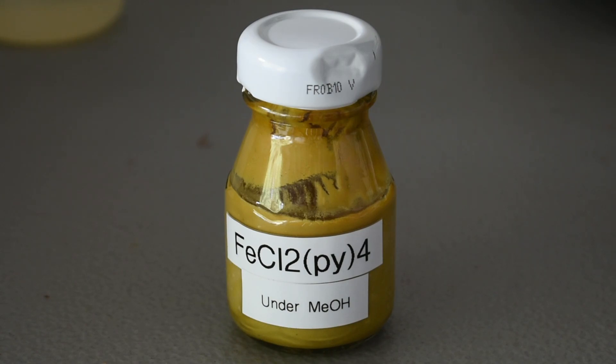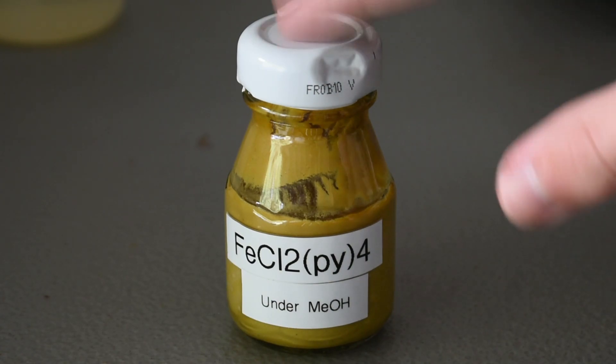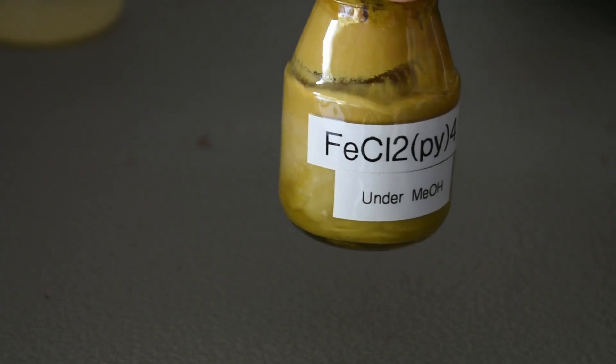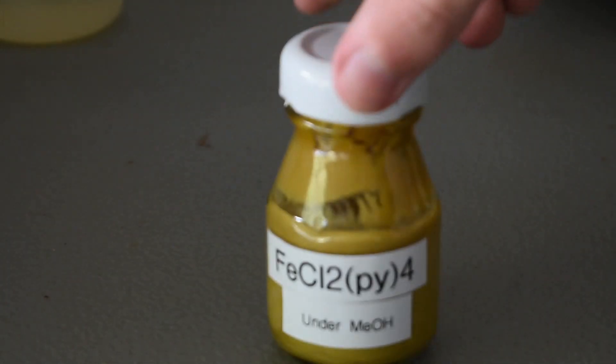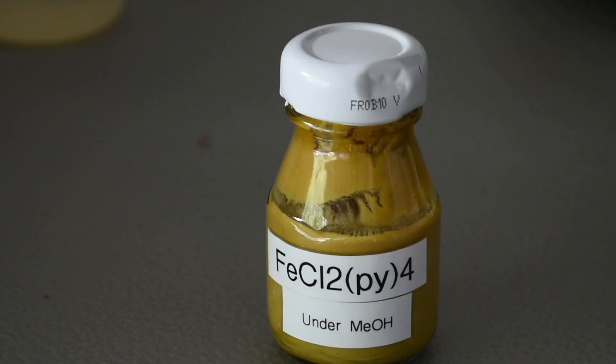Subtracting the weight of the bottle, I have approximately 28.7 grams of product inside the bottle. But it is in kind of a suspension of methanol. So the yield's probably going to be a lot lower than that.